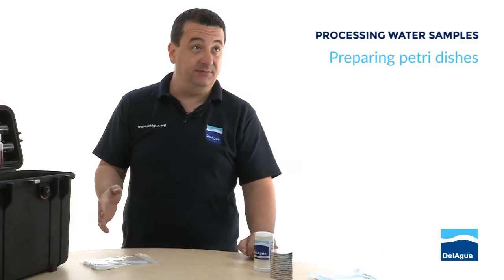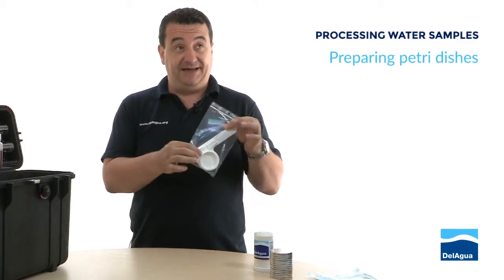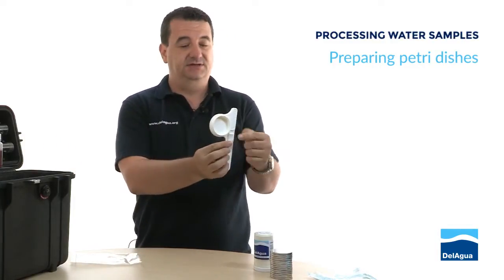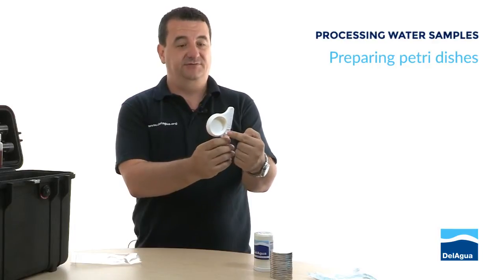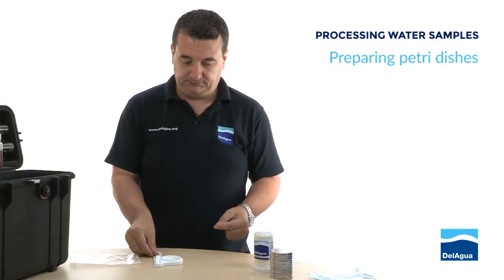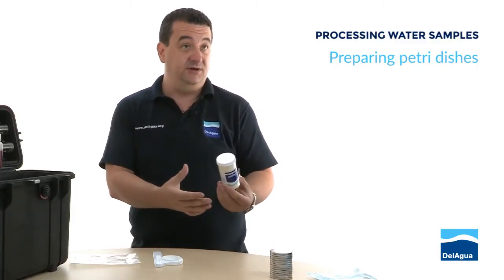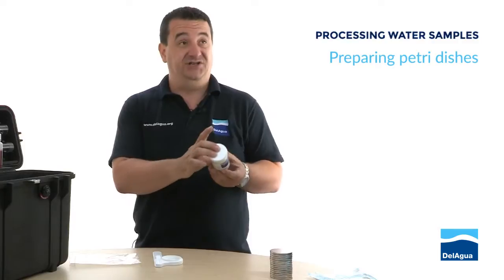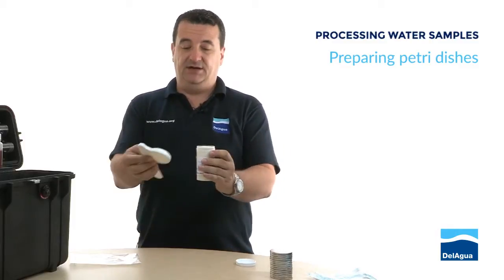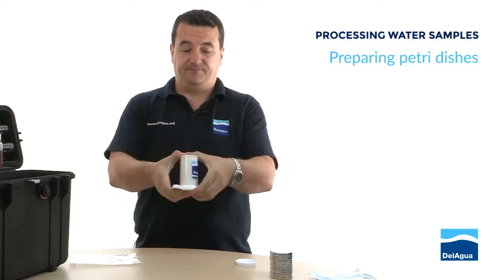We're back from the field now. We've collected our sample and the next thing we need to do is prepare the petri dish. We've got a pad dispenser - nice and clean. The arm is retracted; that's what it would look like if it's the wrong way around. The pad dispenser allows us to put the pad, which holds the media - the food for the bacteria we're trying to grow - without actually touching the pad, because we don't want to contaminate it.